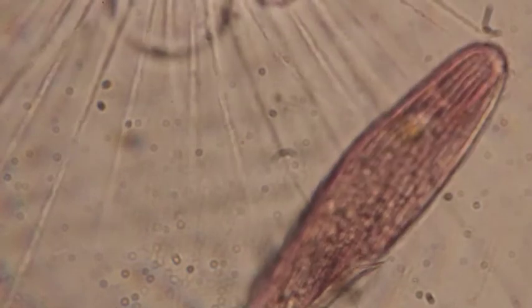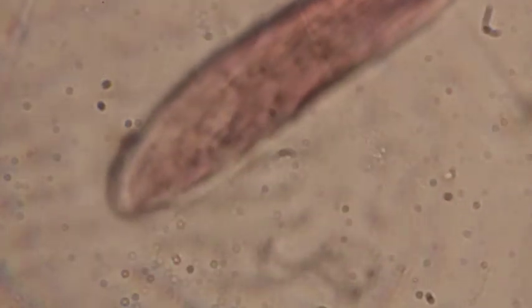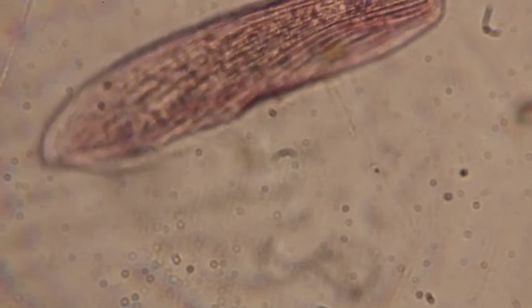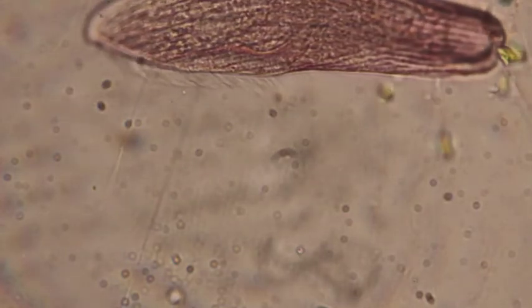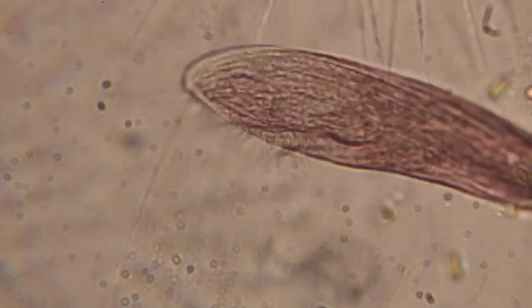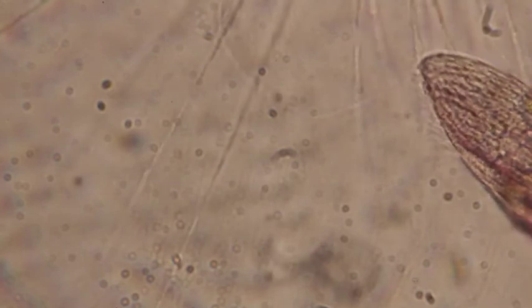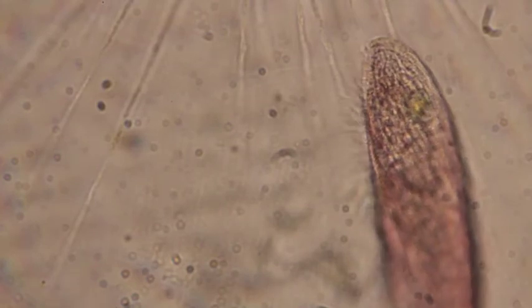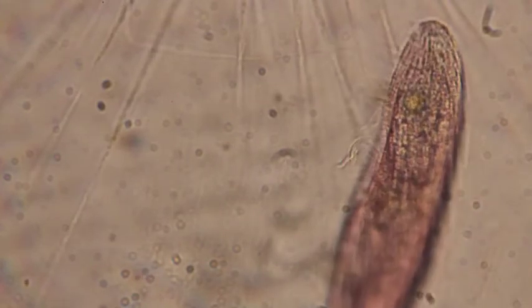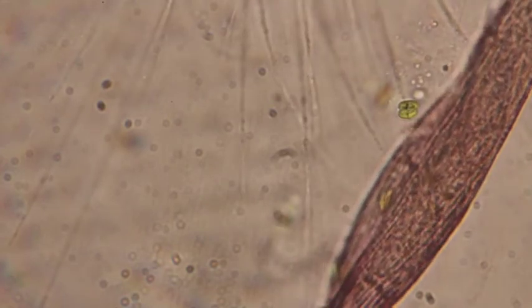We can see the cilia all around the blepharisma, but you can also see how those pseudopodia are attached to the blepharisma, and so it's kind of stuck there and can't get away at all. Okay, so then the actinosphaerium, if it wants to eat it, will slowly hang on to this guy, not allow it to escape, and then eventually it's going to pull it in slowly, drag it in, bring it inside, create a food vacuole and eat it. Okay, a lot of literature shows that actinosphaerium eat quite a few of these blepharisma.